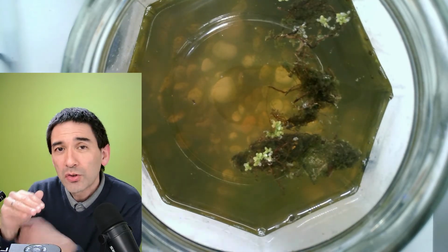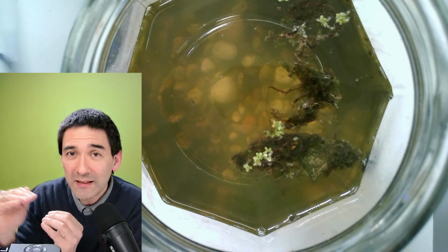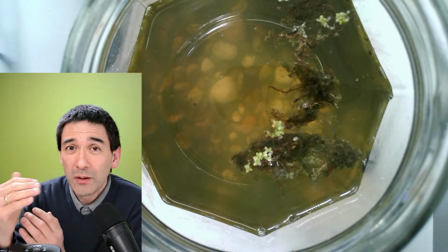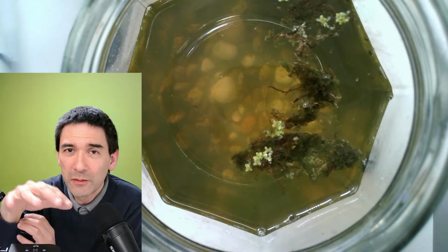Why? Because when you are scanning a slide, and because it's automatically scanned, you need, of course, autofocus. Otherwise, if the specimen is not completely flat, there are going to be some areas that are blurry.